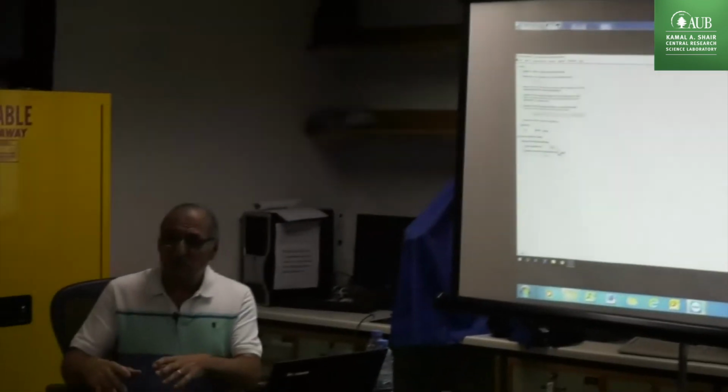If you expose the liquid nitrogen to air, it will change the temperature very fast because it will absorb the oxygen. Remember, the oxygen boils 10 degrees above the liquid nitrogen. Then you can see it: the liquid nitrogen changes color into blue. And if the atmospheric pressure changes during the winter time, it is good to measure it. It takes only a few minutes, but it will give you correct numbers.